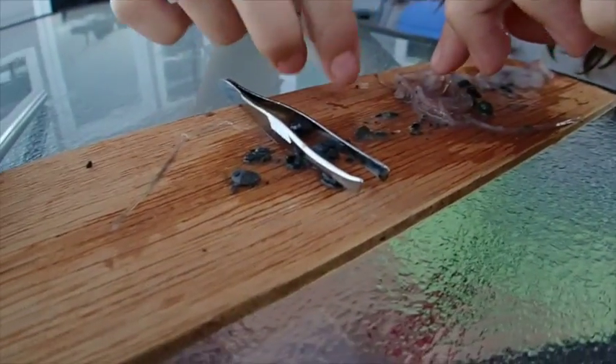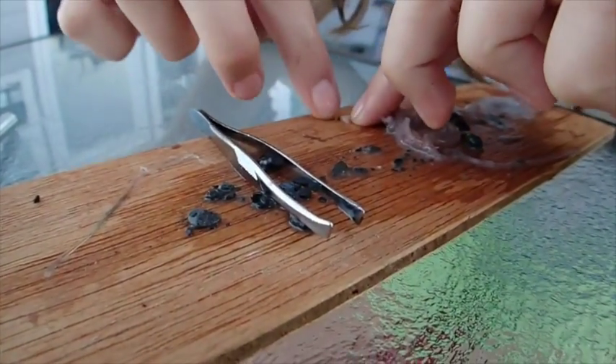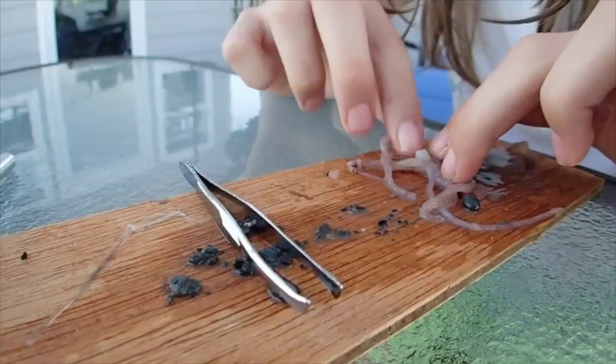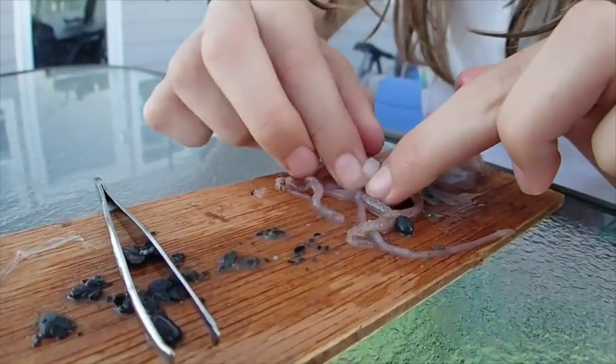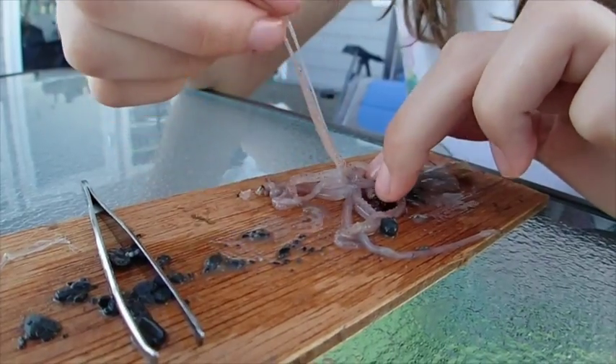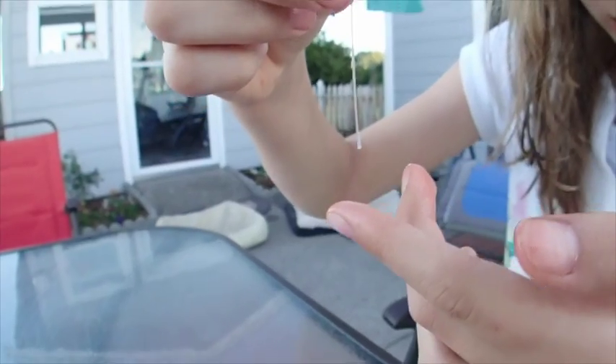This is the little beak — it's called a beak. See that little tip? You're supposed to be able to reach in and pull this — see this little weird nozzle thing? Yeah, it's like a siphon, right? It's what they eat with. Oh, here's his brain — there's a little mouth. That's his brain — a little stringy, gooey.